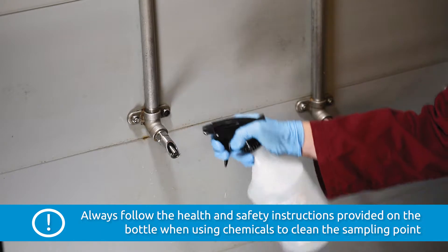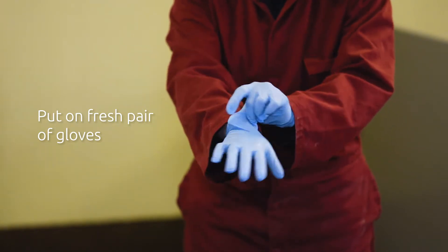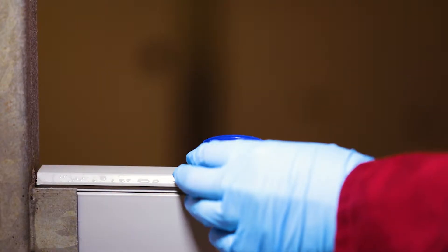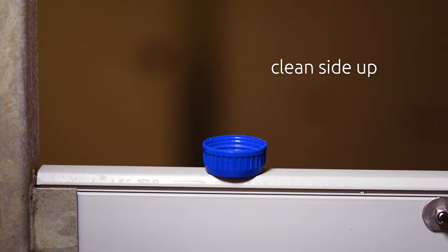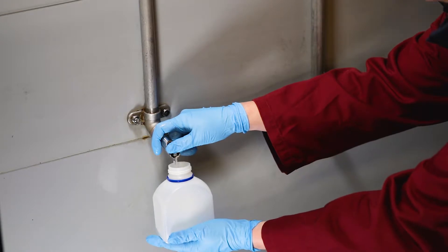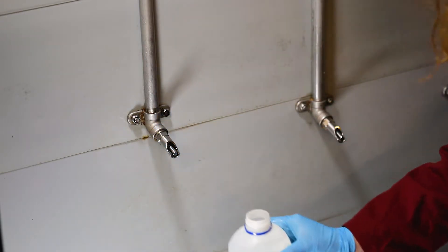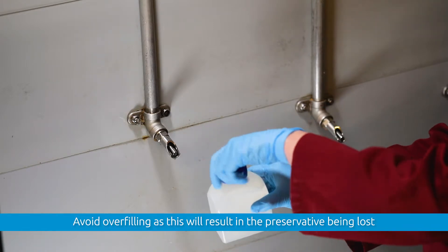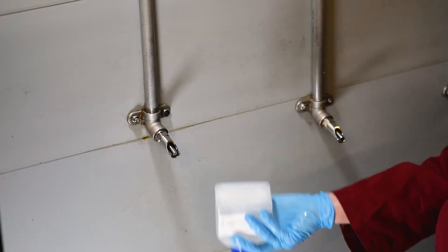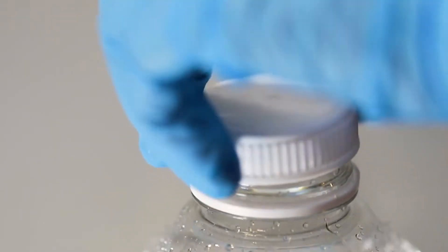You need your sample point to be clean but not disinfected. When the sampling point is sufficiently cleaned, put another pair of fresh gloves on. Run the water for 30 seconds, then unscrew and place the cap clean side up on the cleanest convenient surface. Take care not to spill or tip out the fluid from the blue-lidded microbiology bottles as this is a preservative. Fill the bottle to 2cm below the bottle lip, avoiding contact with the tap, pipework or drinker. Once the bottle is filled, screw the cap on tightly and gently invert the bottle three times. Note: you only need to invert the microbiology sample bottles.